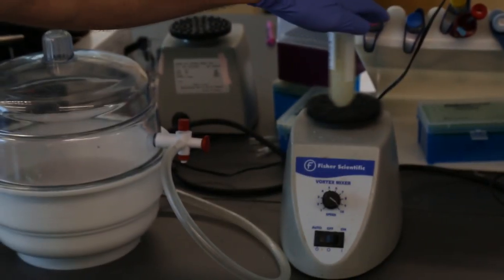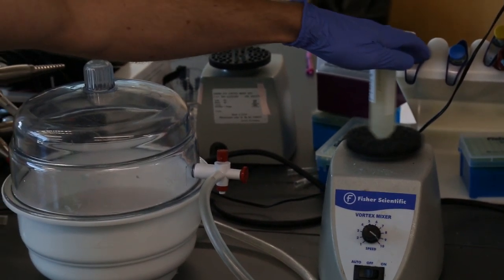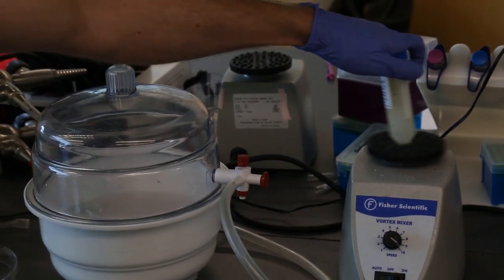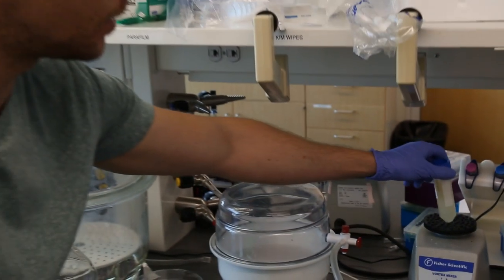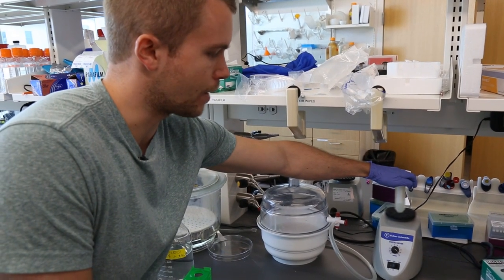What's important is that once you hydrate this, we need to actually disperse it. We're gonna take a vortex mixer, and I recommend vortexing it for around a minute just to guarantee that everything is dispersed. We want to make sure that everything's at least off the bottom of the tube, so we're gonna keep doing this for maybe 45 more seconds.